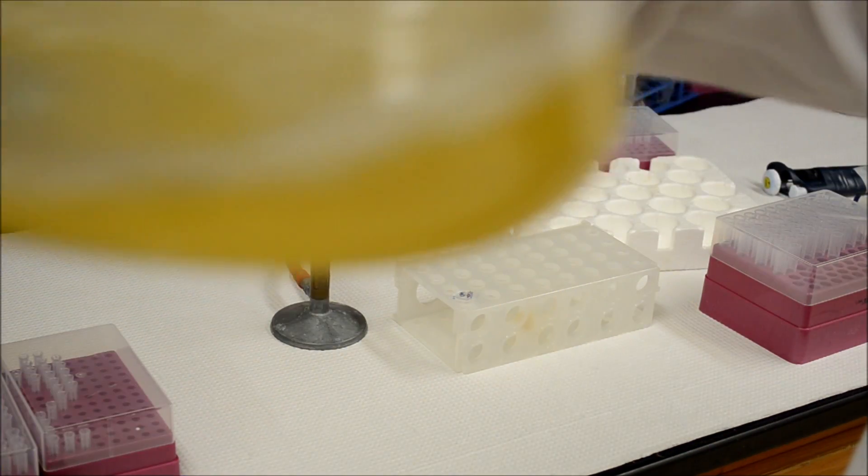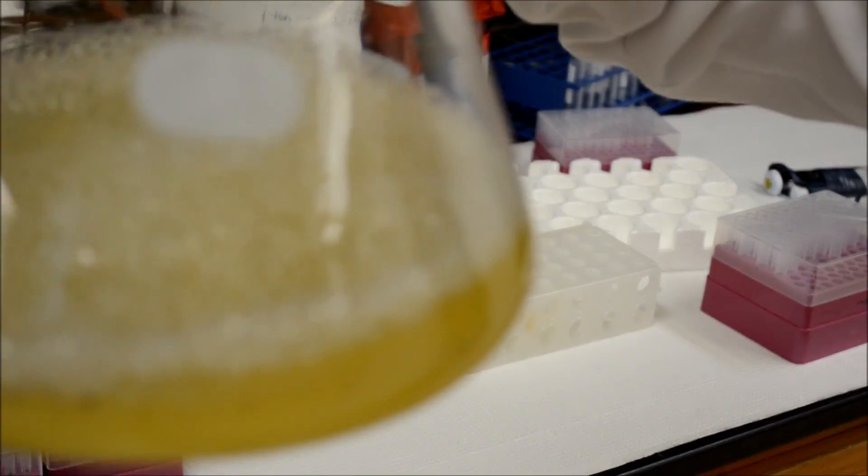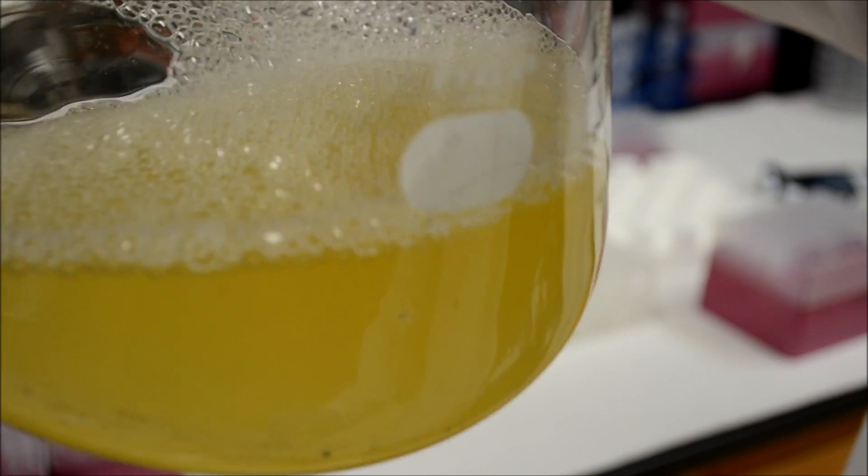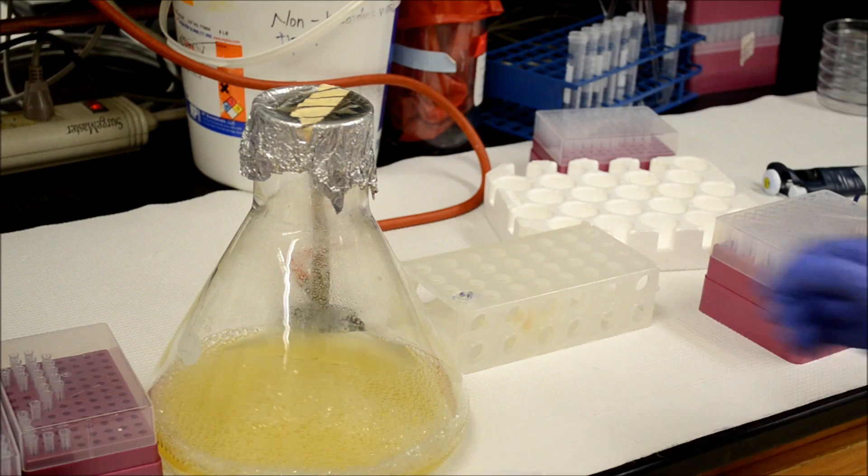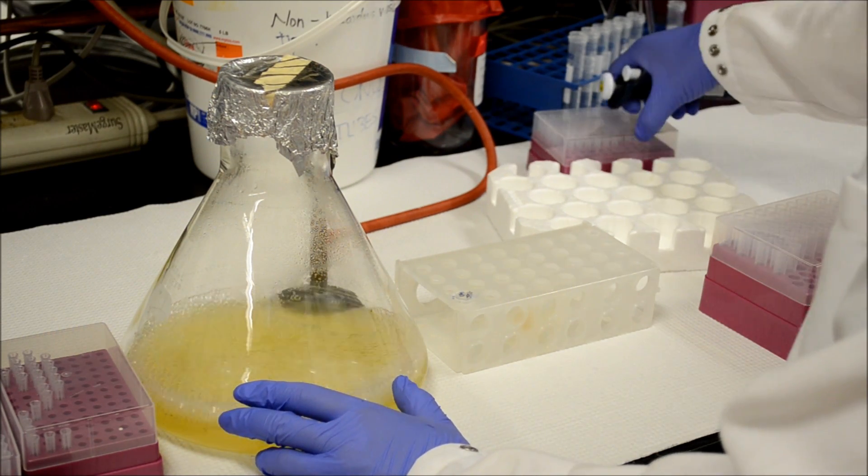You can see that the solution is completely cloudy and opaque. This means that the bacteria has grown to a sufficient level. The next step in this process is to make the bacteria produce the protein that we want. This is a process called induction.